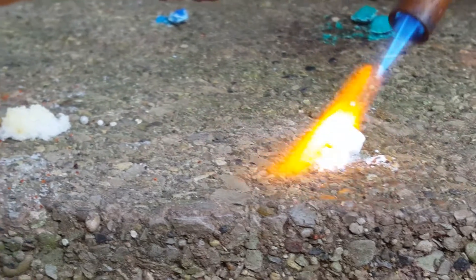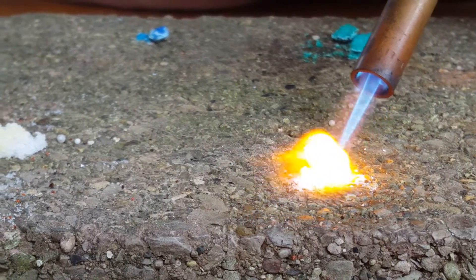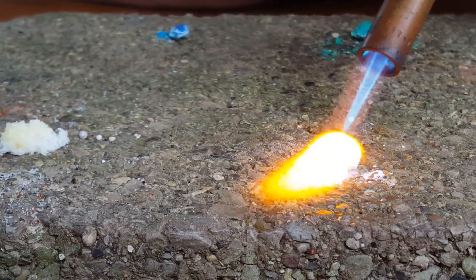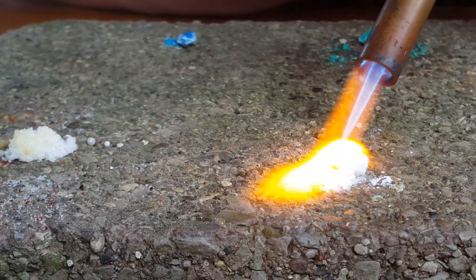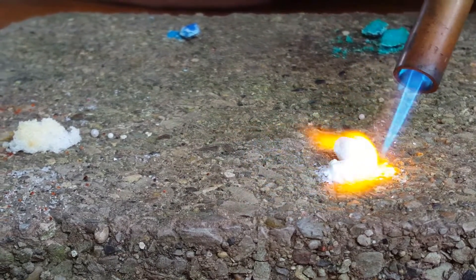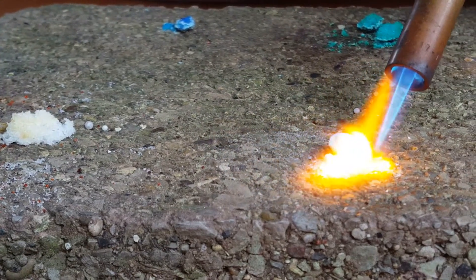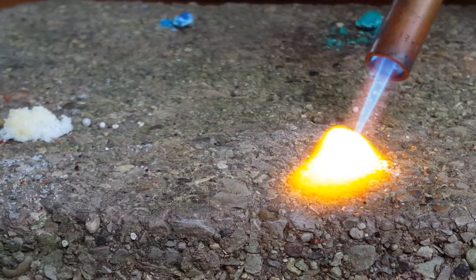This next salt is sodium bicarbonate, and as you can see, it burns with a bright orange flame. This color may be familiar because sodium ions are used in street lamps, so if you see a bright orange street lamp, it has sodium ions in it.